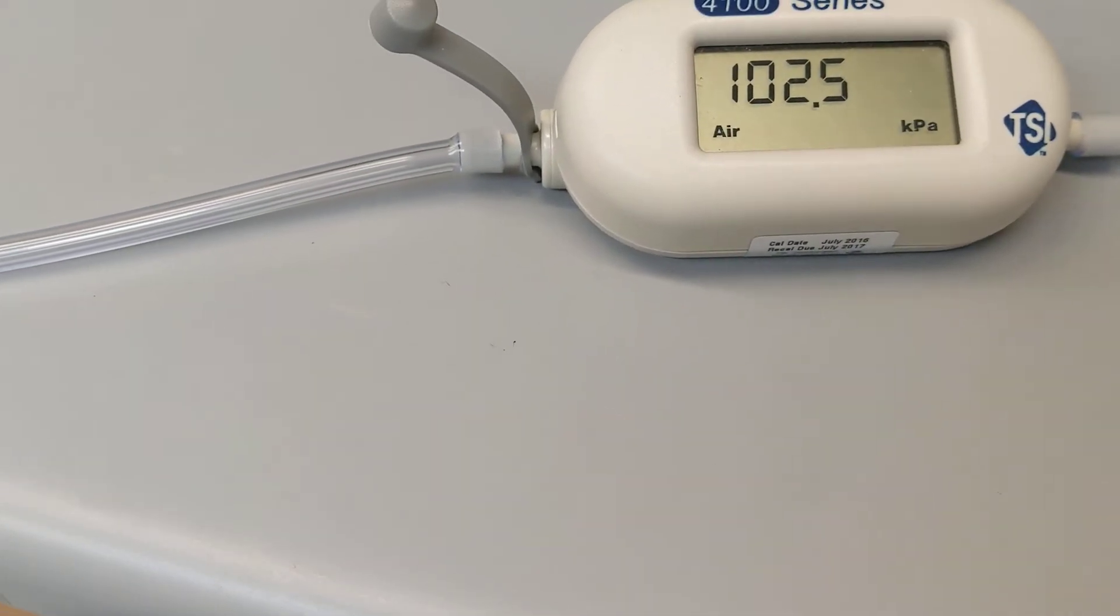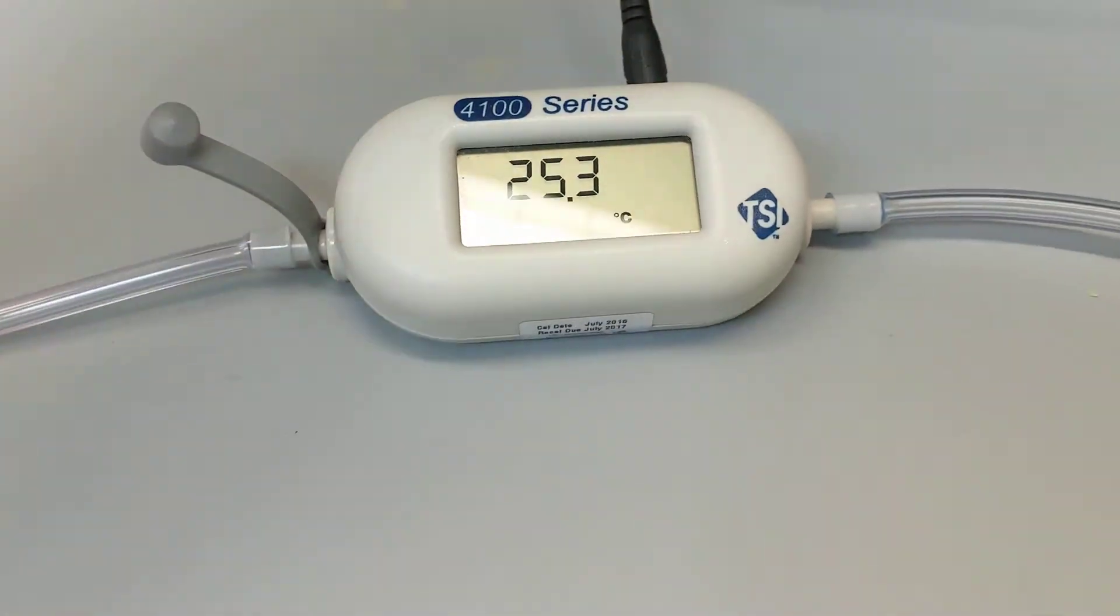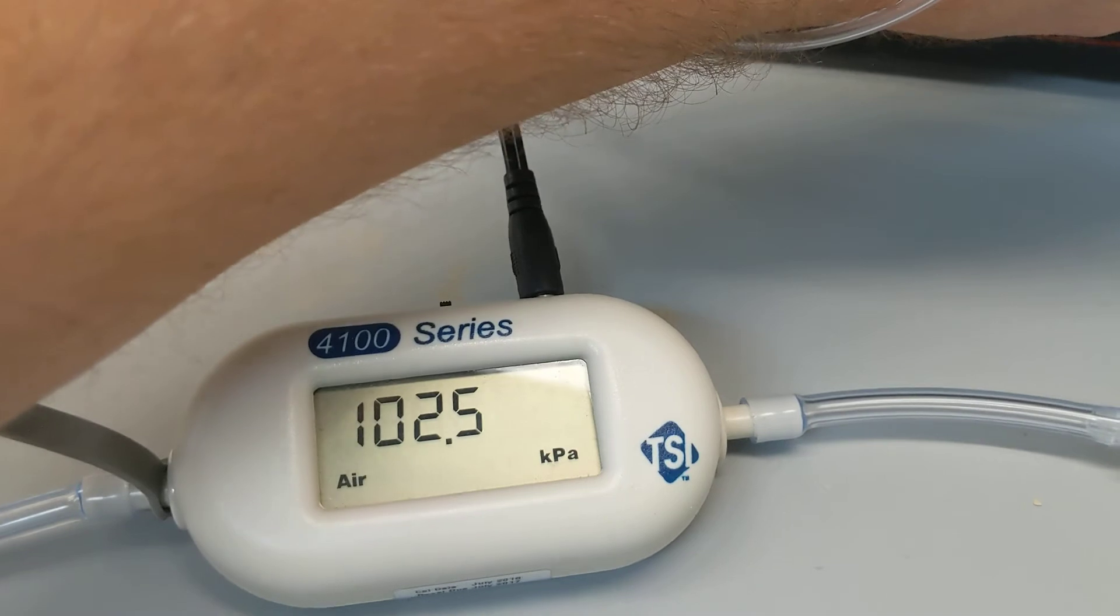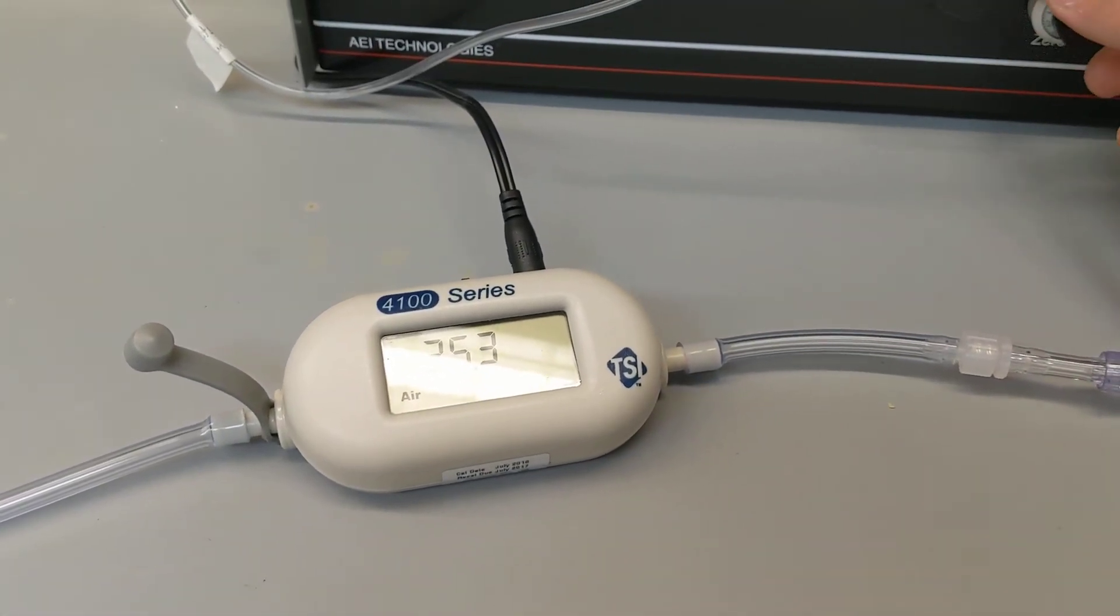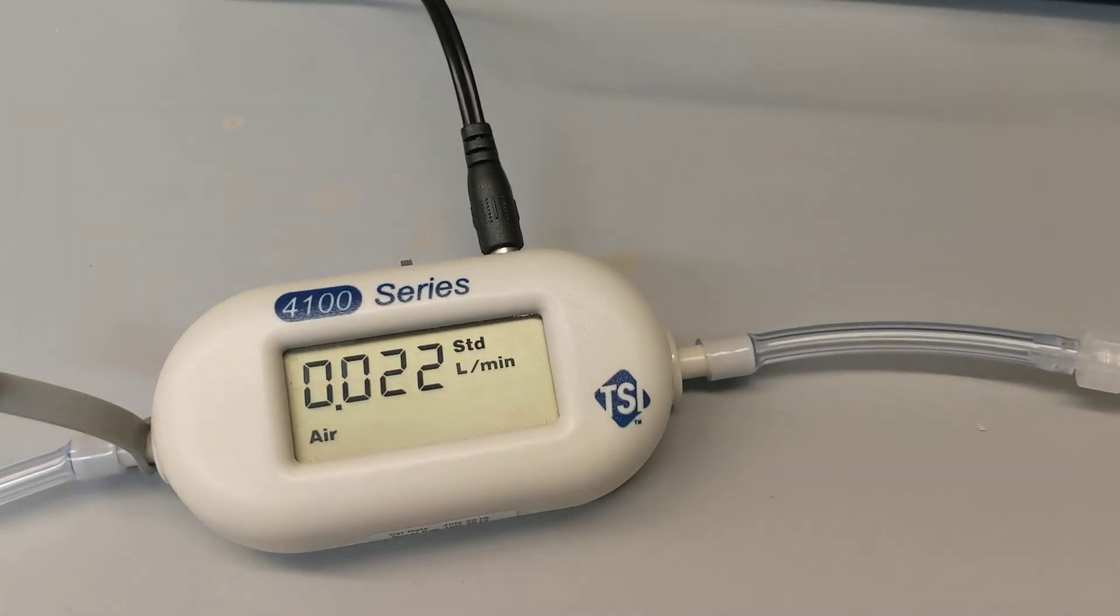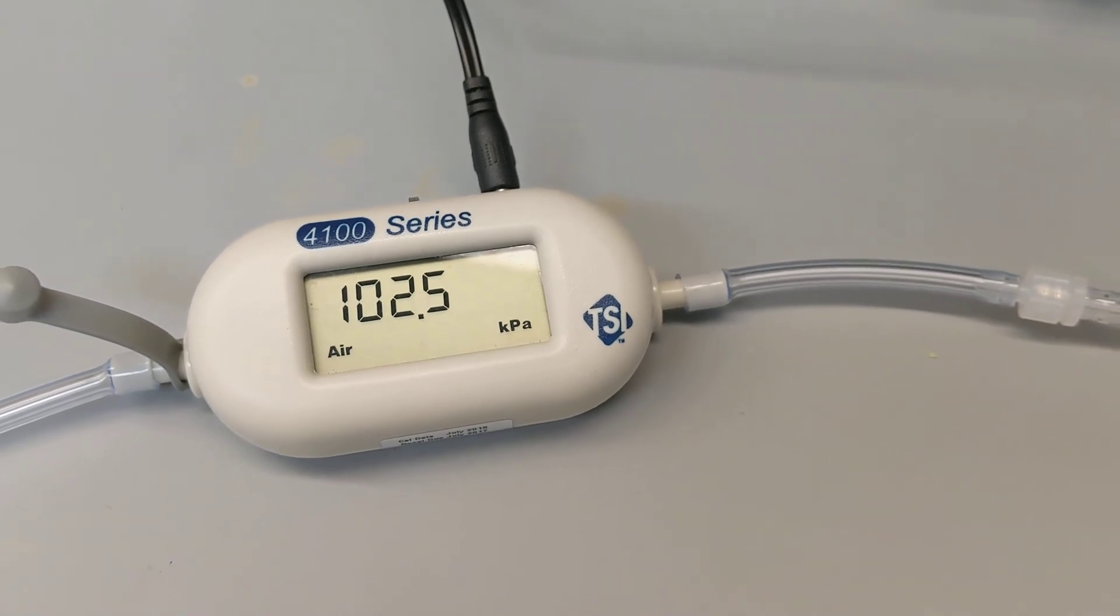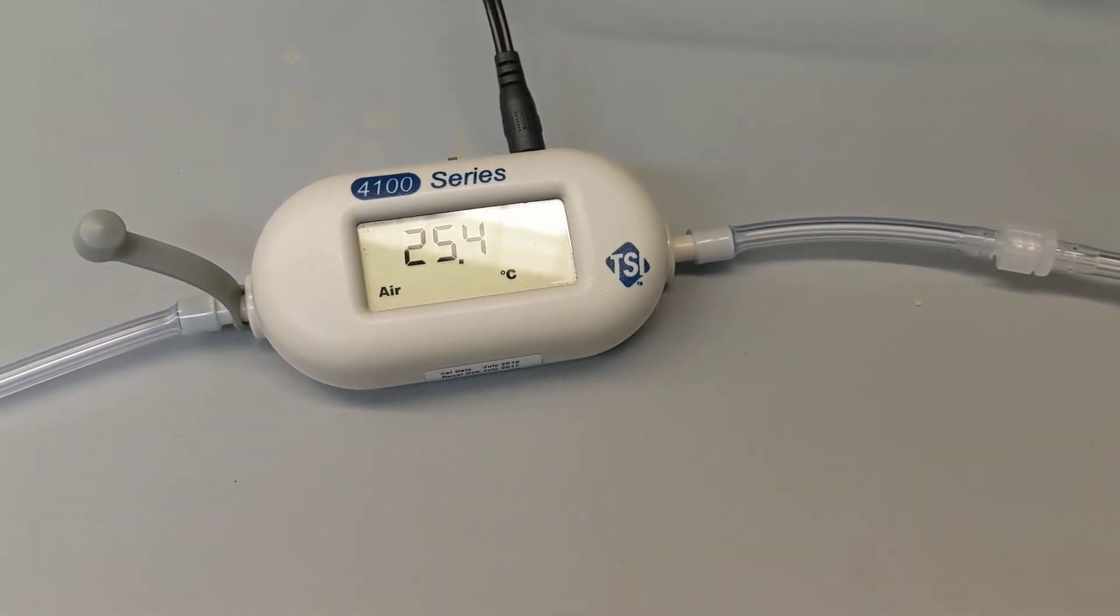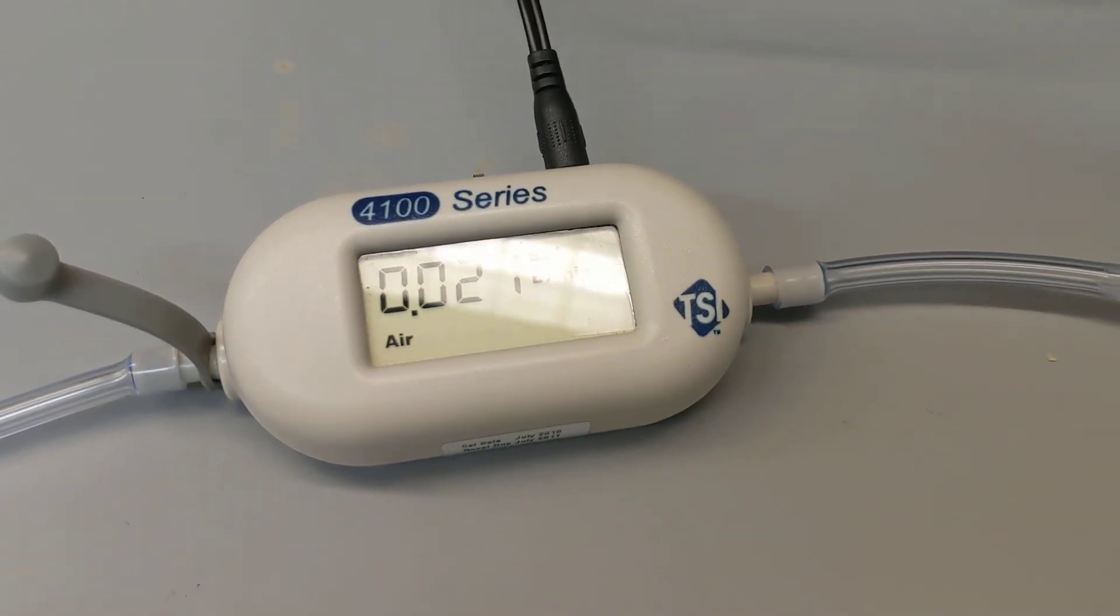And what we could do is look at the screen and actually take a look at the sample that's being pushed through this system. So the data that I'll show you for this particular sample is just a readout, same values that we saw before but just being pushed through from a closed circuit sample rather than being pulled through.